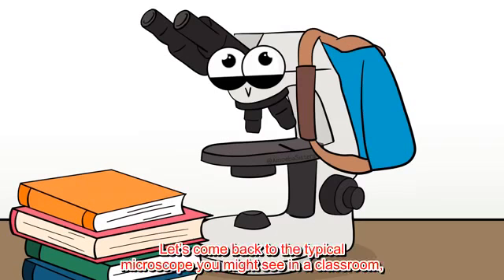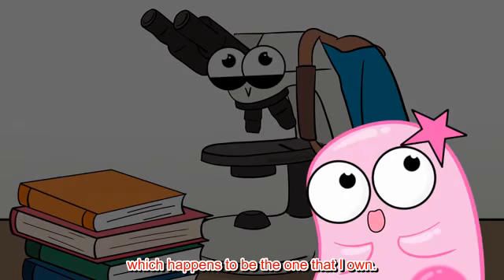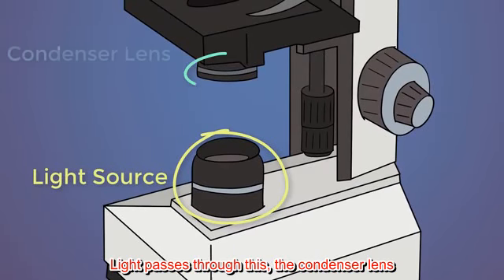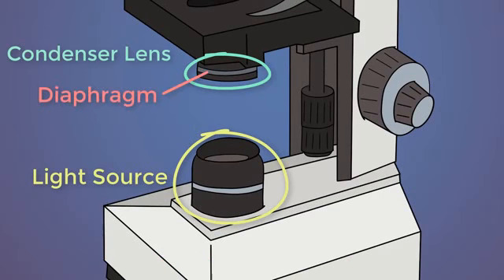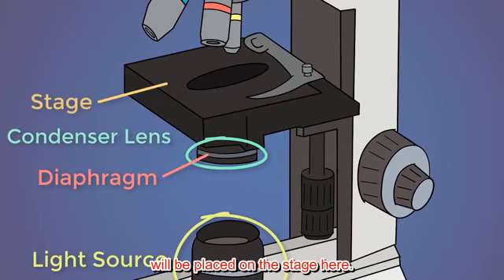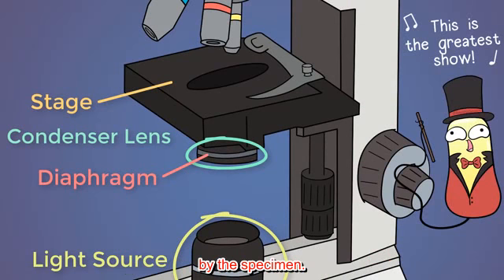Let's come back to the typical microscope you might see in a classroom, which happens to be the one that I own, a bright field light microscope. Here's our light source. Light passes through this, the condenser lens, to focus the light on the specimen. The level of light can be adjusted by the diaphragm. Our specimen, likely to be on a microscope slide, will be placed on the stage here. Light will be reflected, refracted, or absorbed by the specimen.